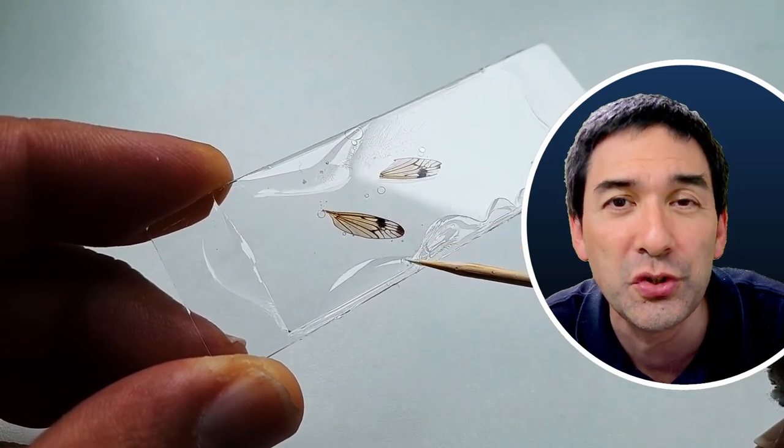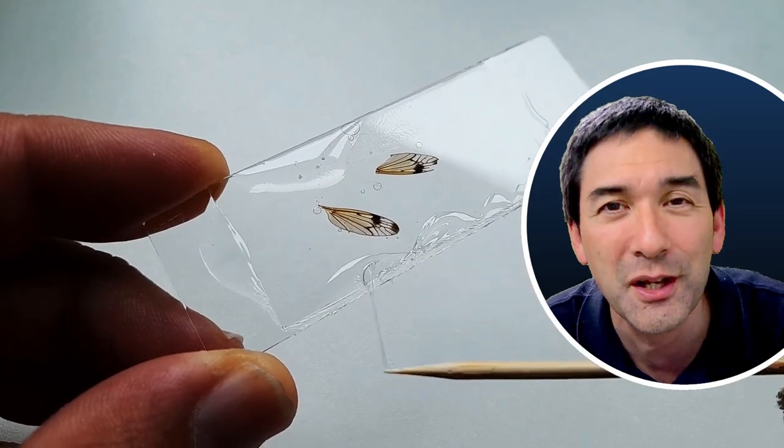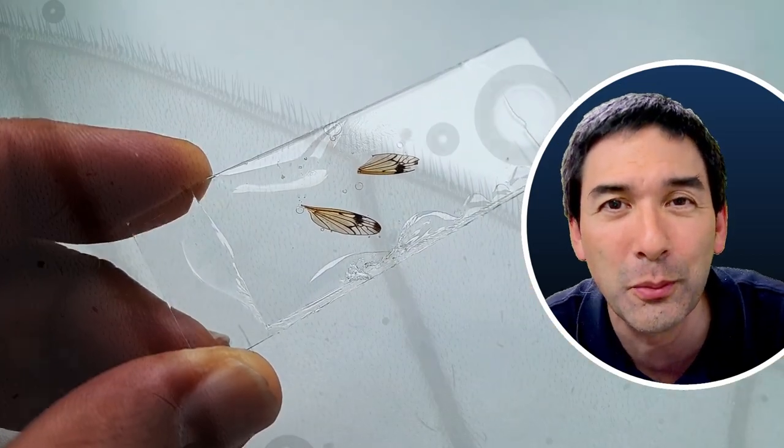This is also a reason why you should not use this cover glass now to observe it directly, because otherwise you might get some glue on the microscope objective. So let it dry first and then you can observe it.